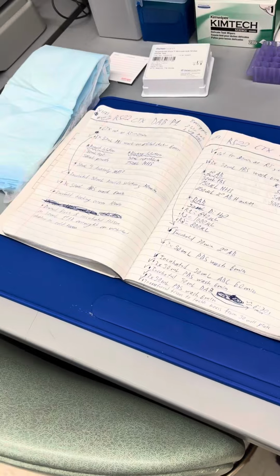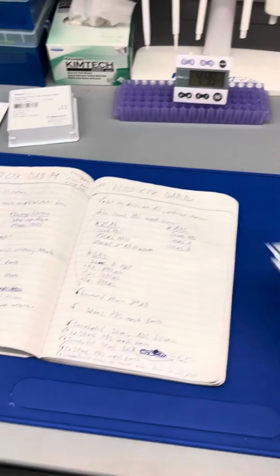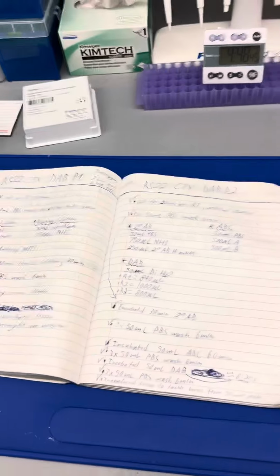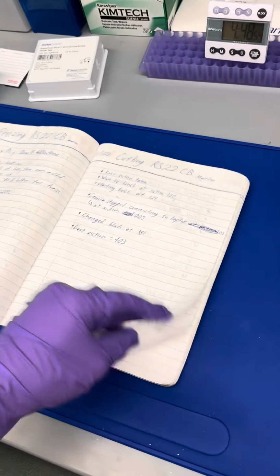It's okay to have the protocol printed out. I have a front and back protocol on purpose. I also have one in here that I usually reference front and back in case I can't remember, but usually once you do this a billion times you should be able to. And I'm not saying that as pressure, I mean you'll be able to remember it even if you don't want to. And I just kind of go through it like that, making sure I mark the dates for everything.